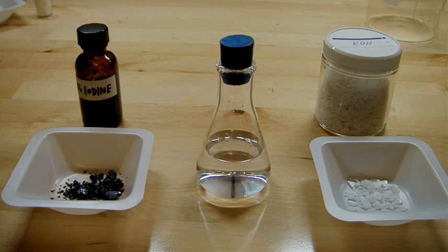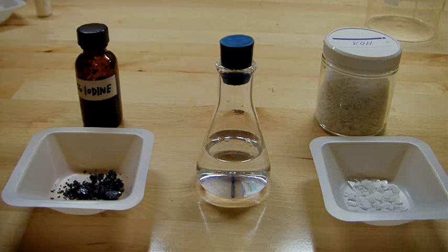In today's video, I'm going to be making potassium iodide from the reaction of elemental iodine with a hot concentrated solution of potassium hydroxide.